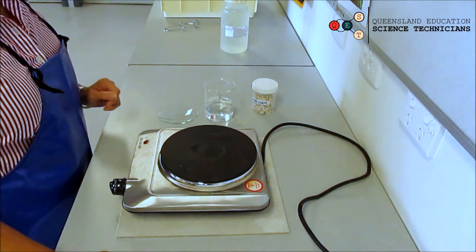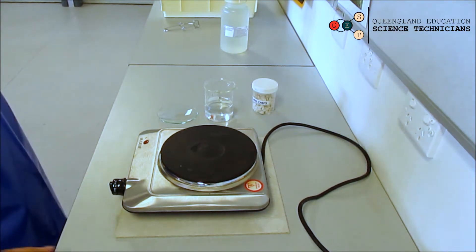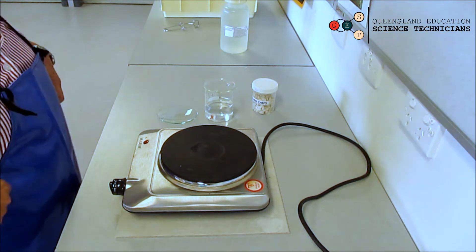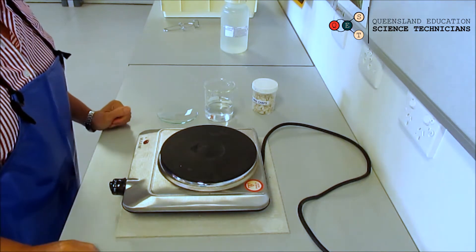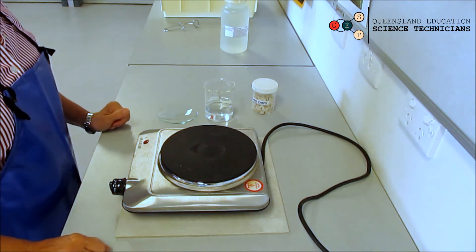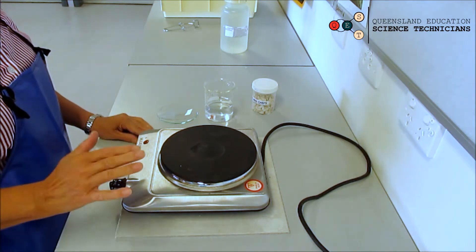Hi, we're here to talk about evaporation. Make sure that you have your aprons on and your safety glasses on. Then you go and collect all your equipment, which in this case is a hot plate, a hot mat, a beaker, and a watch glass.